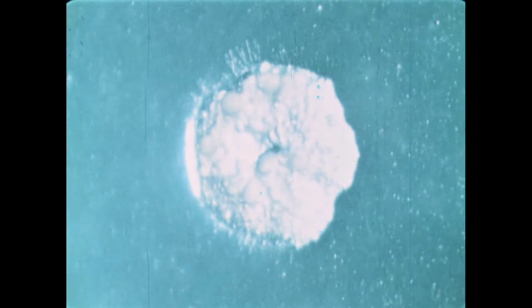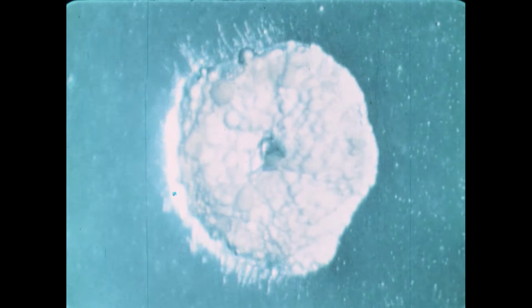These plants, in turn, produce 3rd, 4th, and 5th-generation plants, many of which eventually form resistant sporangia, possibly due to high carbon dioxide levels which result from crowded conditions. These resistant sporangia vary in size and color. The colony reaches this stage in about 5 days, and then ceases to enlarge.